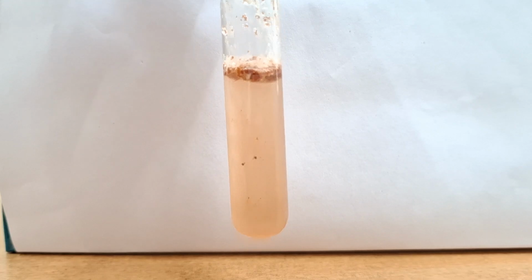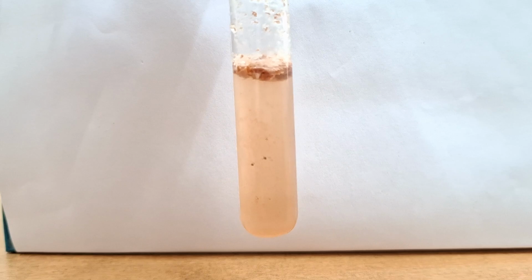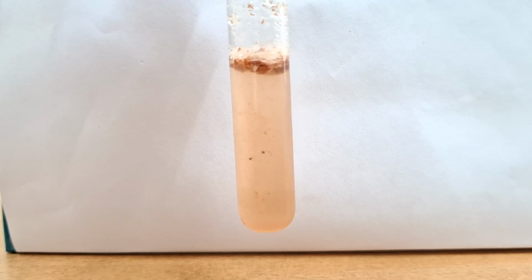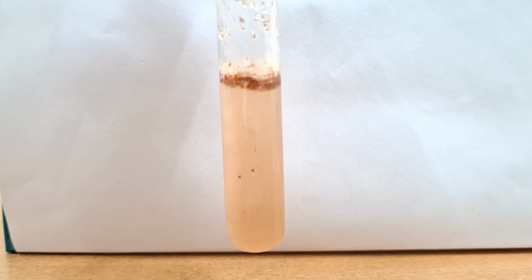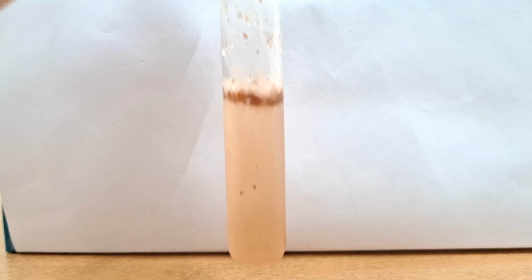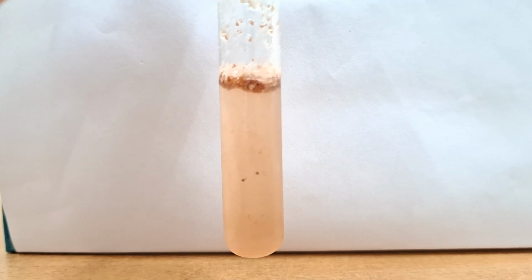You might not see it. Okay, and the inference of this particular test is that the hydroxyphenyl group is positive. So what amino acid contains a hydroxyphenyl group? That is tyrosine. The tyrosine amino acid is positive in this particular case.